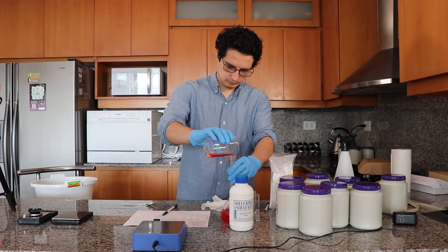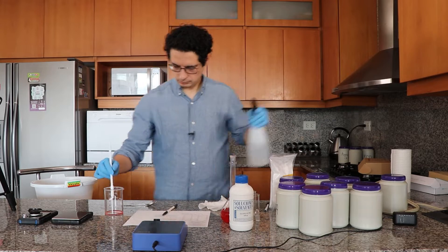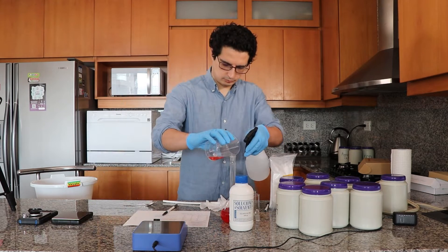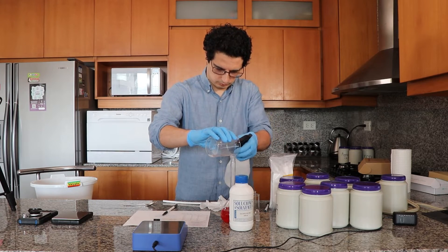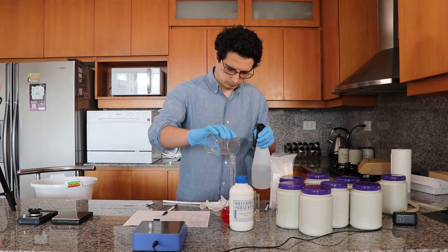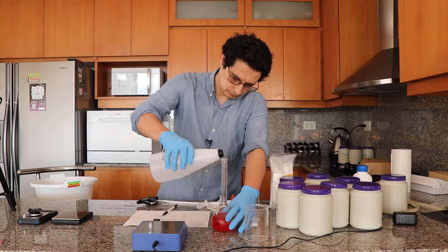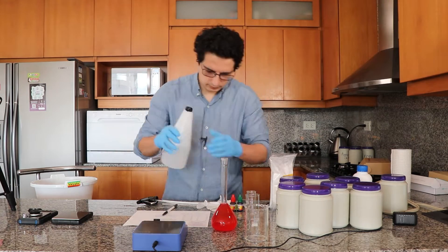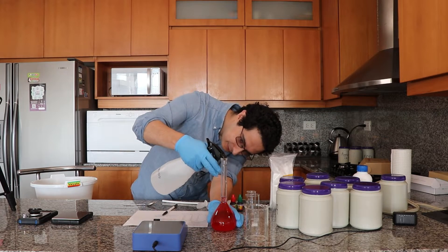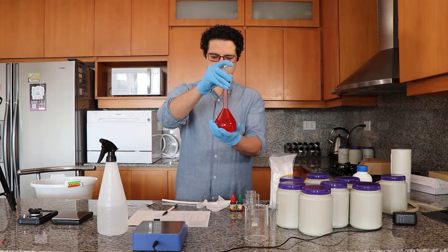And of course I am going to be using distilled water to fully wash the beaker to ensure I transfer absolutely everything. In this case, since I have a magnetic stirrer, I'm also washing the magnetic stirrer with distilled water to ensure no liquid remains in the stirrer, and then I fully wash the beaker with distilled water to make sure I get all the salts in the volumetric flask. Now I'm going to take the volumetric flask to its final volume using distilled water, being very careful not to go over the line. Now just a matter of stirring it.